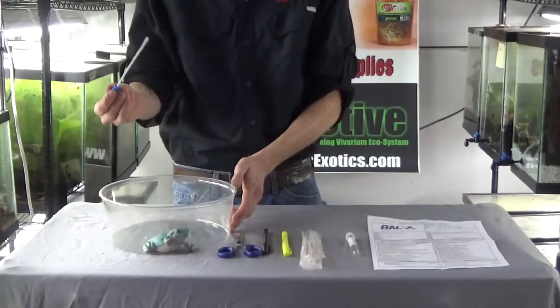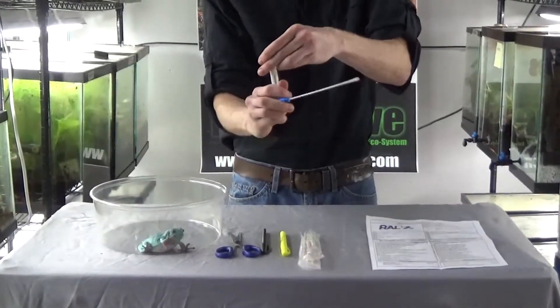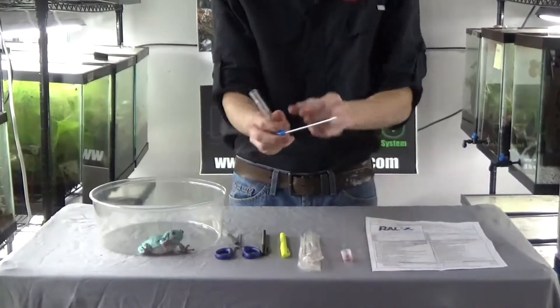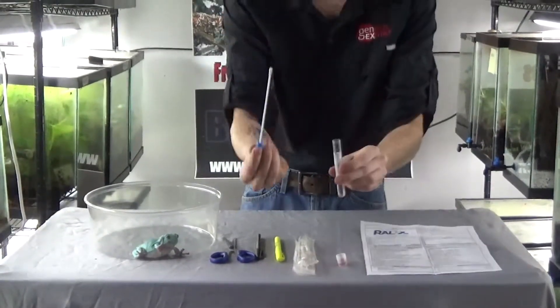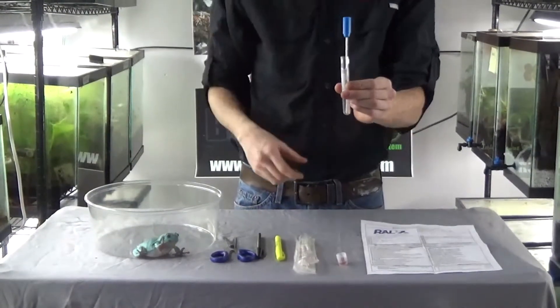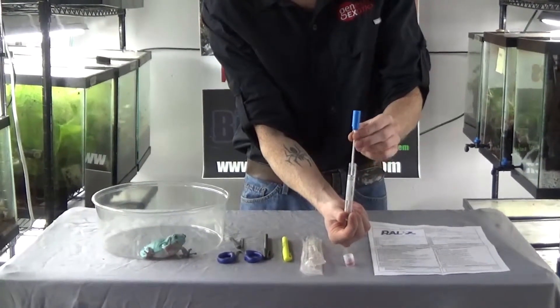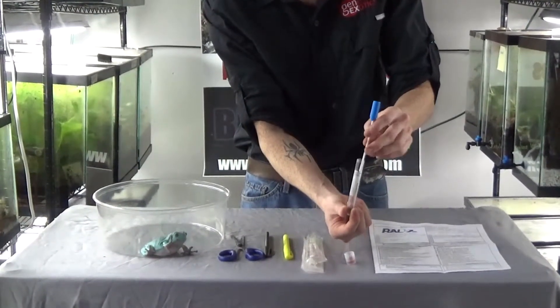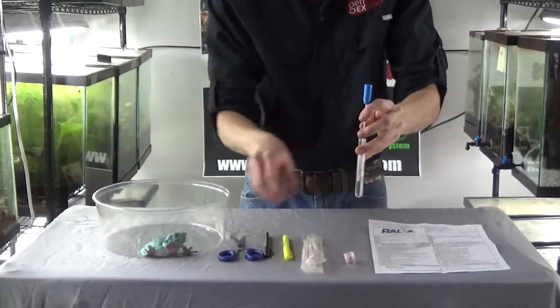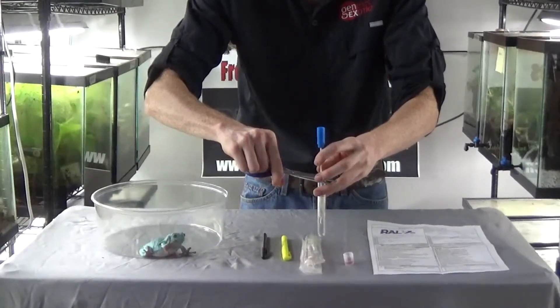After you get an adequate sample, grab your sterile tube and open it up. Simply take the sterile swab and put it inside, right like that. From there, pull it up with your fingers at the base at the top and hold it like this. Then take some scissors and cut it underneath from where you were holding.